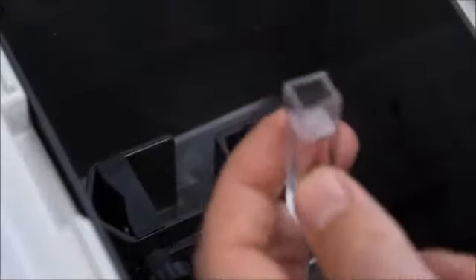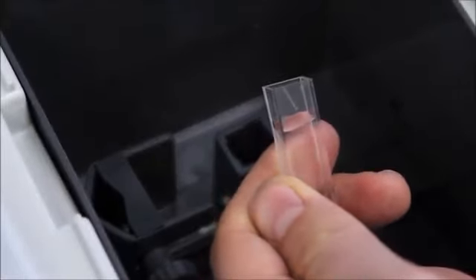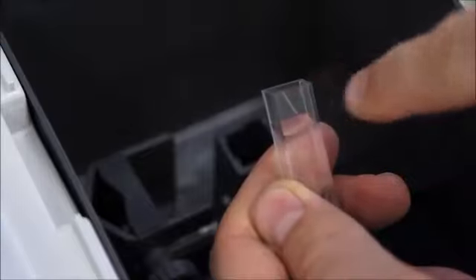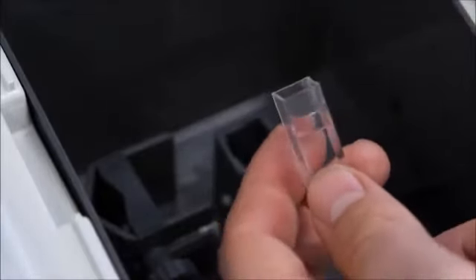Open the sample compartment and place the cuvette in the cuvette holder oriented specifically such that the triangle on one of the non-frosted sides is facing right. The importance of this proper cuvette orientation can be simply demonstrated.